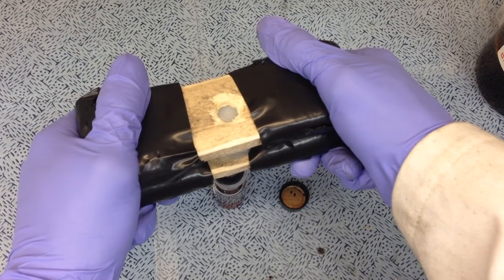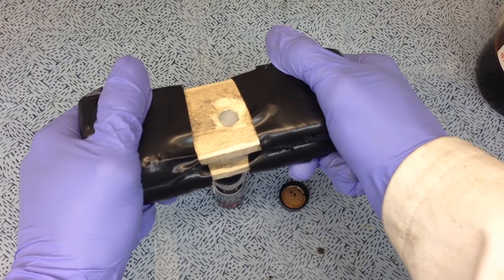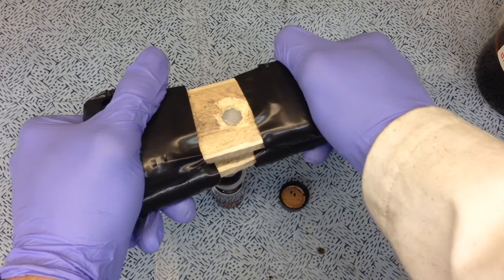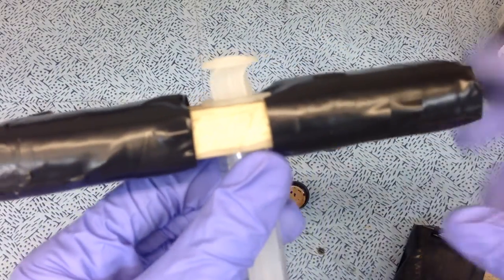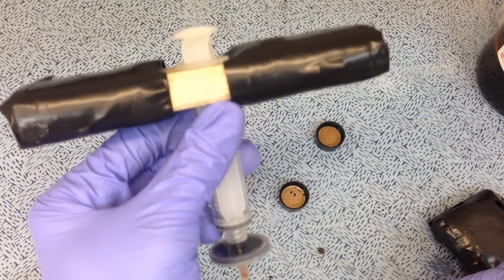If you had to use these syringe filters all day, just as they were, you probably wouldn't be able to do it before your hands gave out. But I have used this all day, and it's actually not so bad. So even though it was a really cruddy sample, and it had a lot of precipitate, and we bent the top of the plunger, that's how efficient these are. You'd never really be able to do that with bare hands.